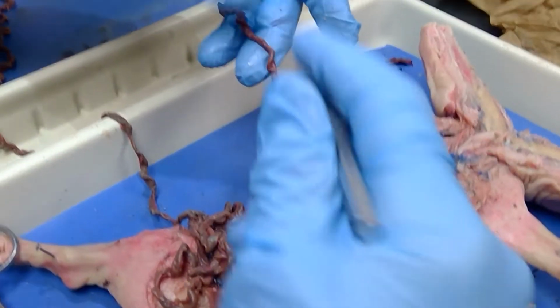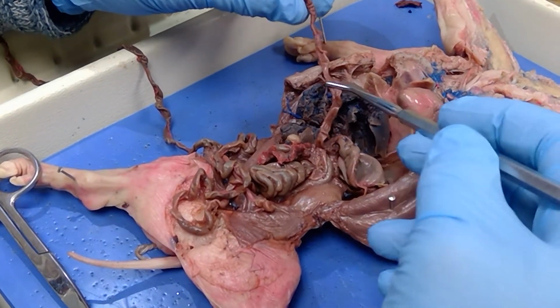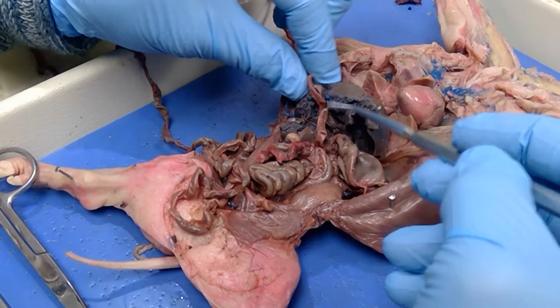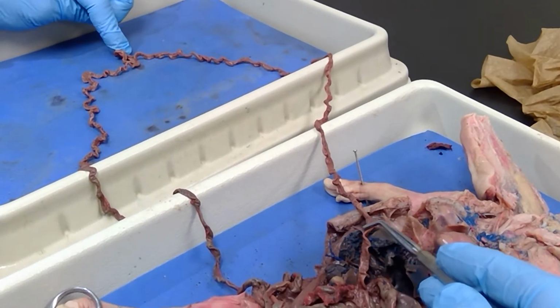So we have all of this right here as your small intestines. You can see we have it all strung out this way. So the first inch, or first inch or two maybe, is the first part of the small intestines, and that would be called the what? Duodenum. Okay, the middle part is the jejunum, so I would say it would come over here.